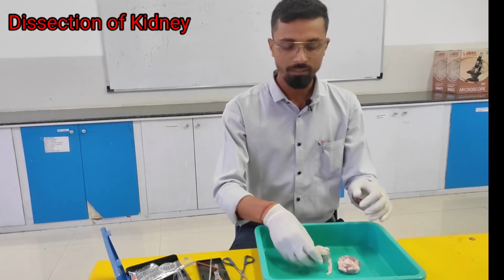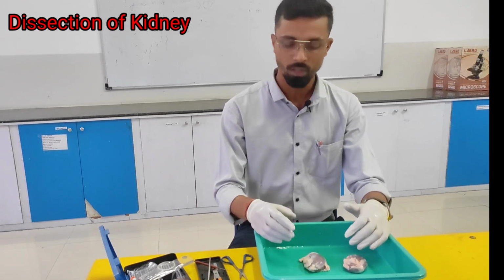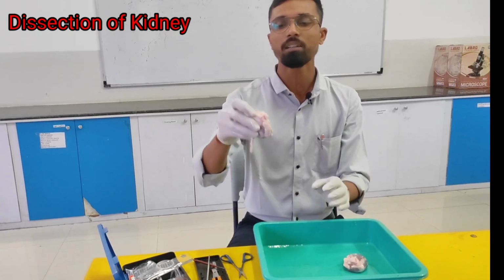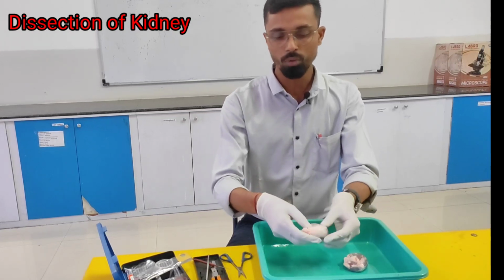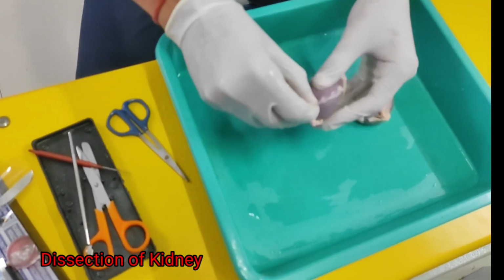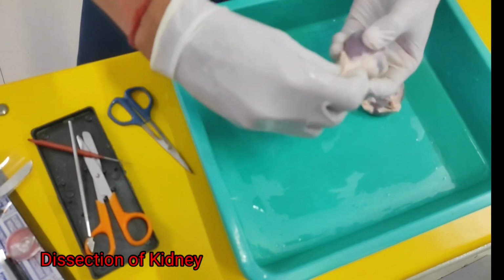Okay, so we have a pair of kidneys. This is a goat kidney, and we will see the internal part of the kidney and the outer things, how it looks. You will see the kidney is covered with fat tissue. We'll remove that fat tissue and later show you the internal part. See how we can remove the outer fat layer from the kidney, and later we will see the kidney bean shaped structure.